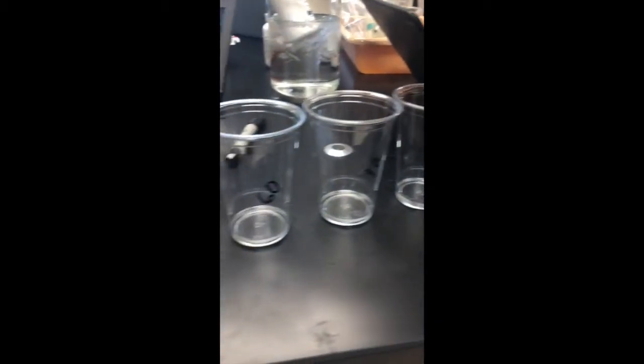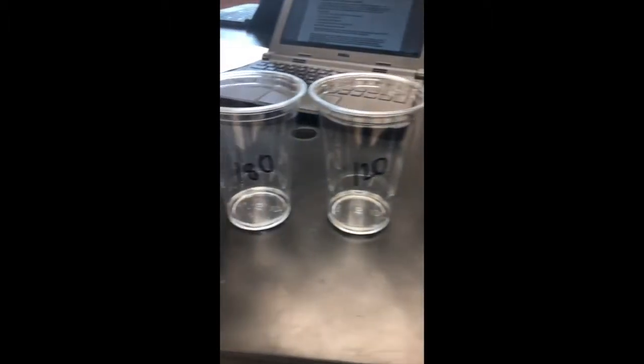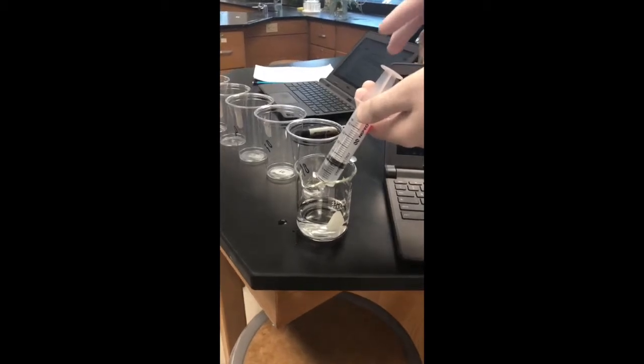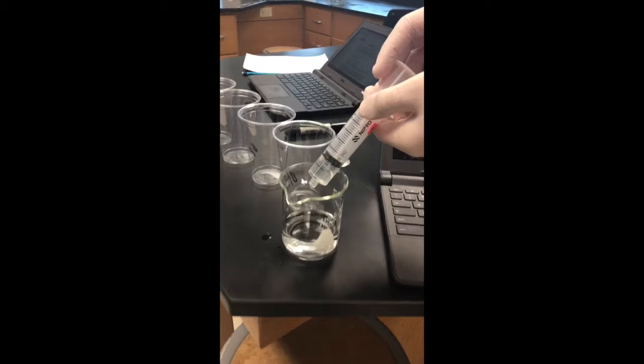In this experiment, our goal will be to determine the rate at which a 1.5% H2O2 solution decomposes when catalyzed by the enzyme catalase. In order to accomplish this, we will determine how much of the H2O2 has been consumed after 10, 30, 60, 90, 120, 180, and 360-second time intervals.